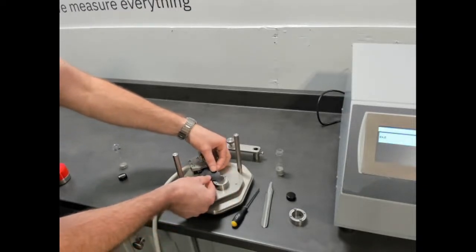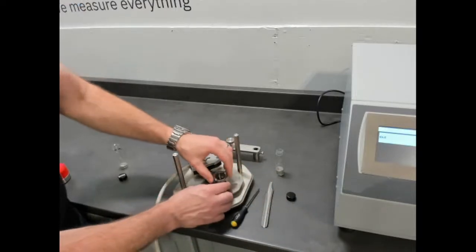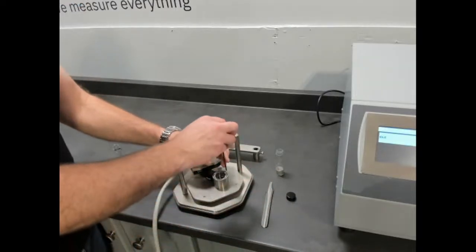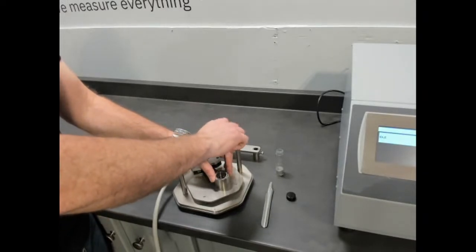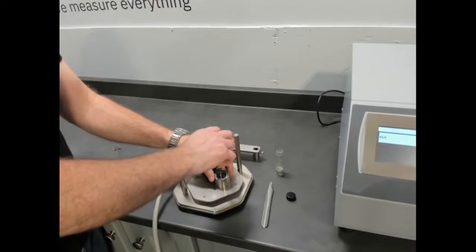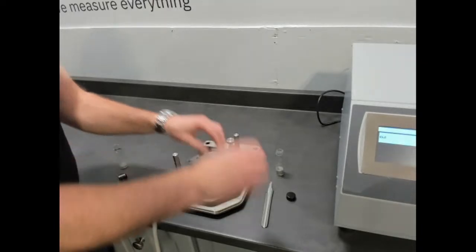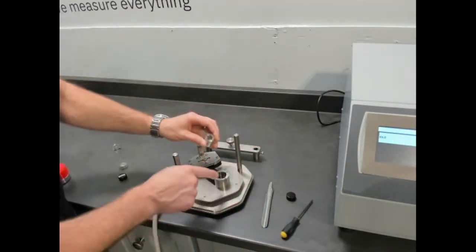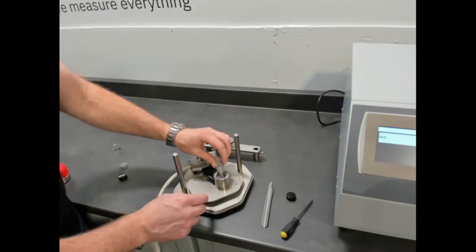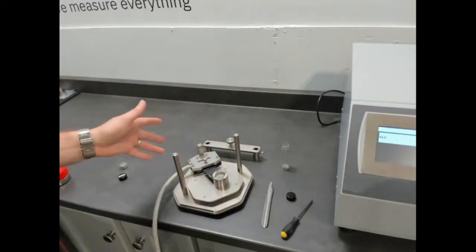We place the sensor in the opening and align the screws from above. These just keep what are moving parts in one place. We're not really applying any pressure through these. It just locks everything in location. The sensor's still aligned. And then we might tap it 3 times just to seat the powder.